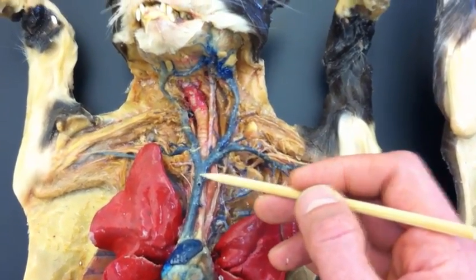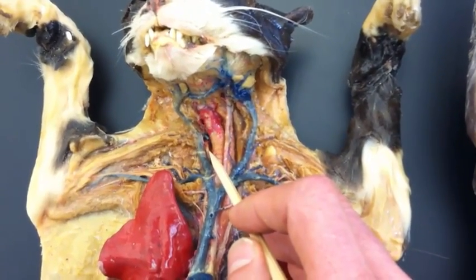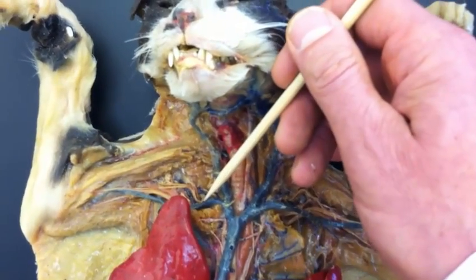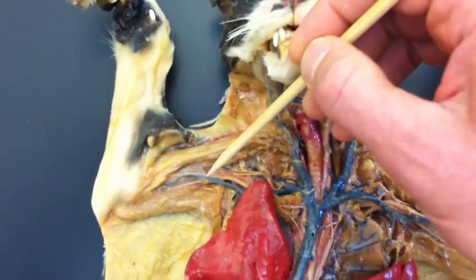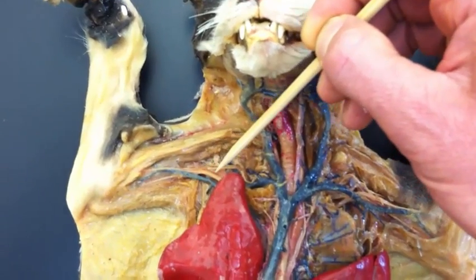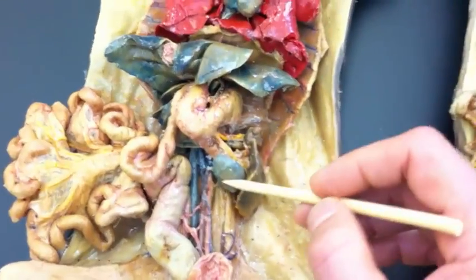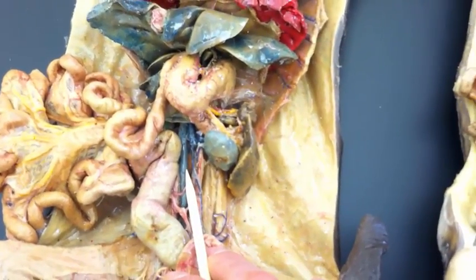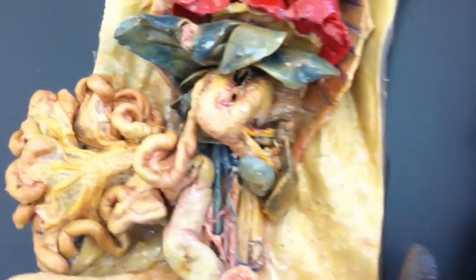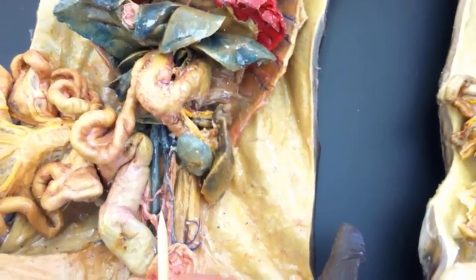Superior vena cava. And then just to go through them, you can see a little bit of the right common carotid there. And right next to it is right jugular vein. Here's right subclavian vein. Out here in the arm, we've got right brachial vein and right brachial artery. Small but visible. And then let's go into the abdomen again. What's this big blue vein? That again is inferior vena cava. And next to it, but a little bit hard to see, we can see the abdominal aorta.